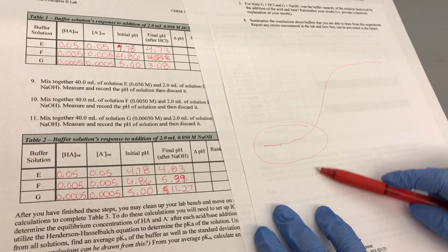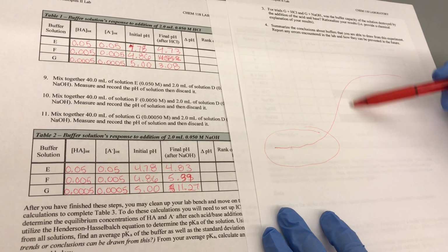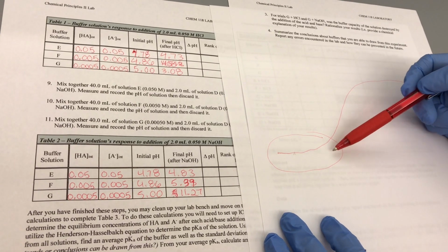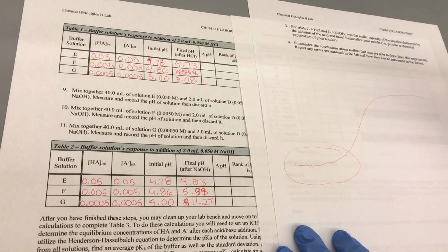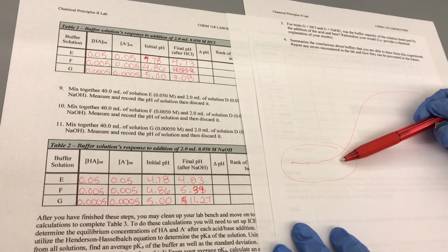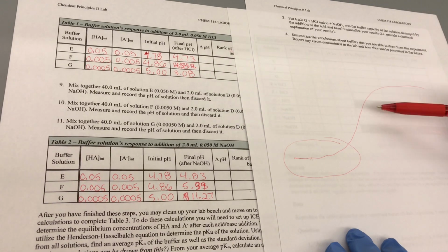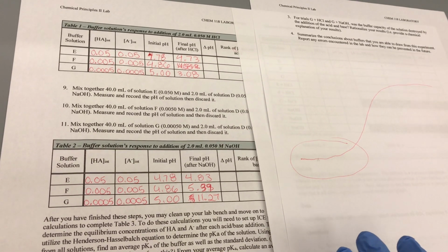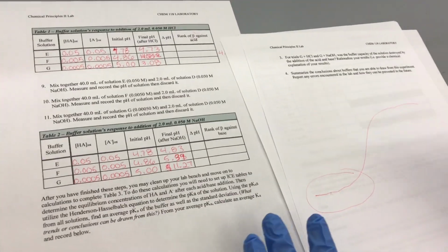When you add too much acid or base, you don't have a buffer anymore because the buffer region means it's resisting pH. So it's essentially asking, is it still resisting pH? If it's not, then that much is destroying your buffer. If it is resisting pH, then you would see the pH still be about 4 point something.